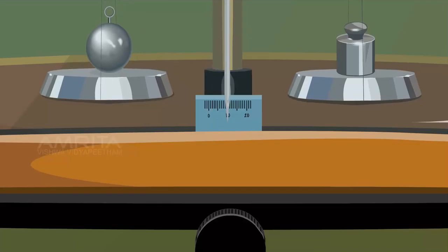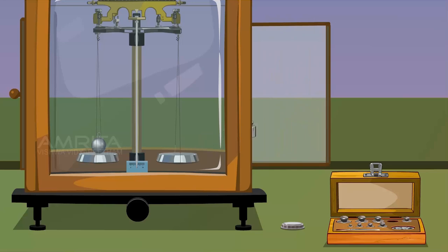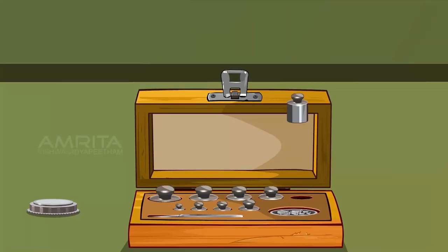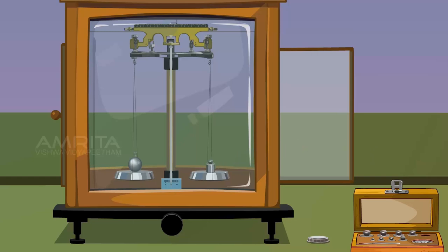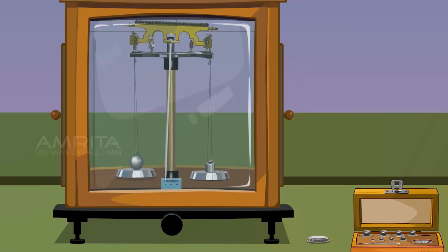Arrest the balance, open the door, and remove the weight. Place a weight of 10g, 2 grams. Now close the door again and release the balance. The pointer points to the left.